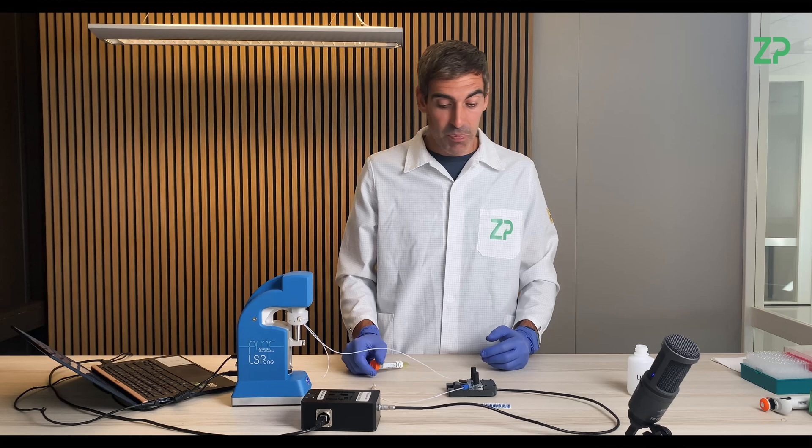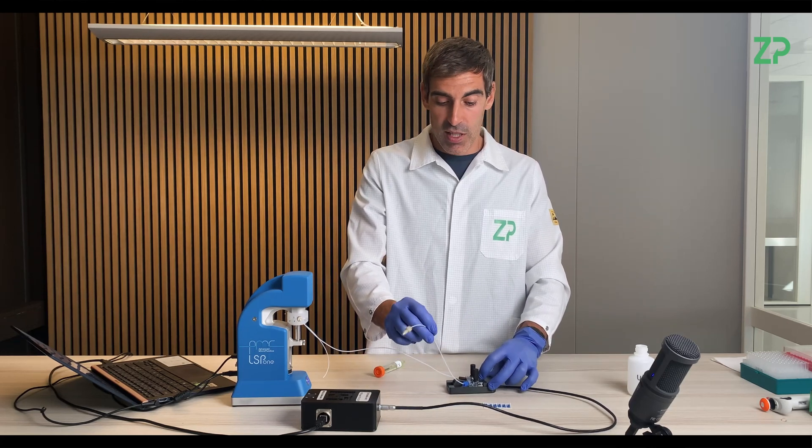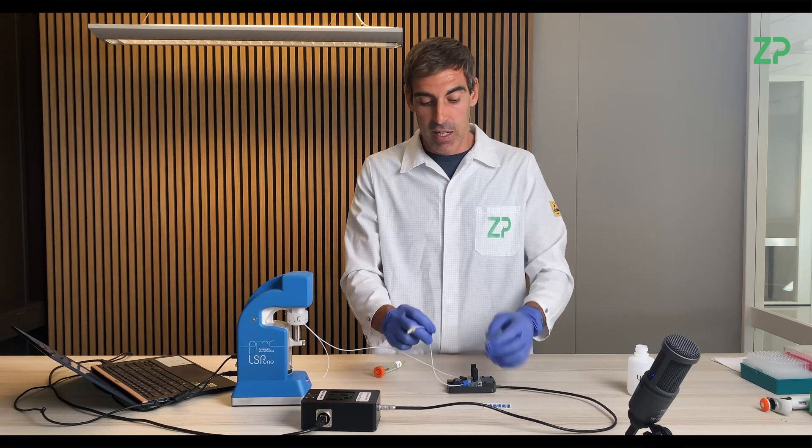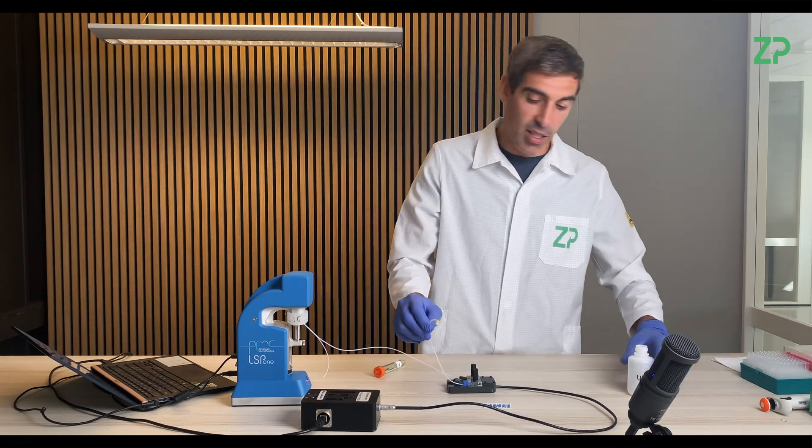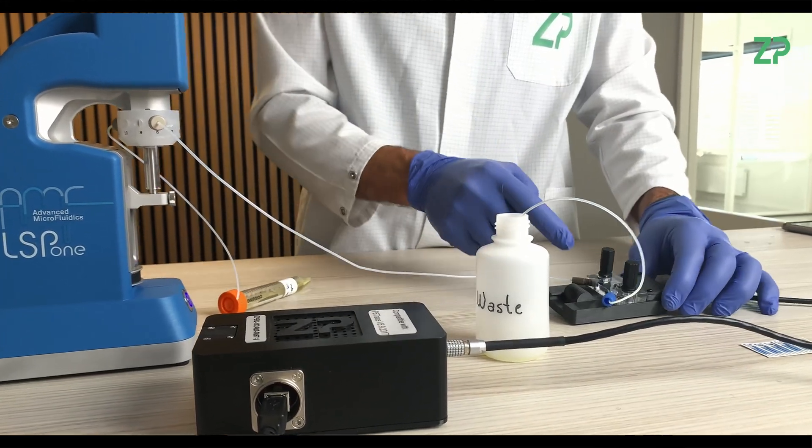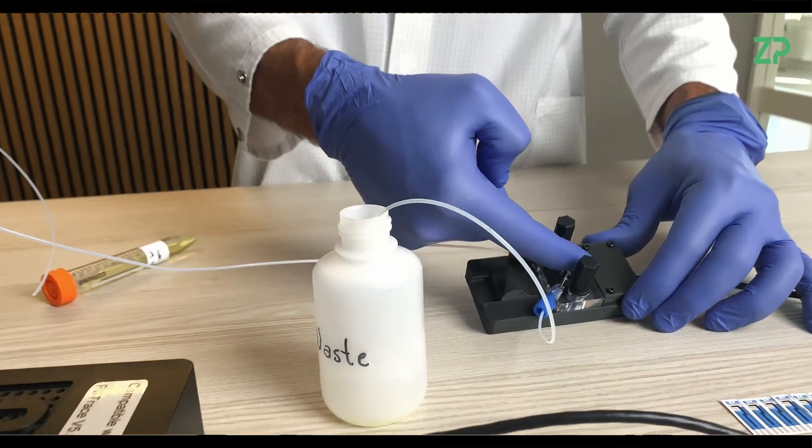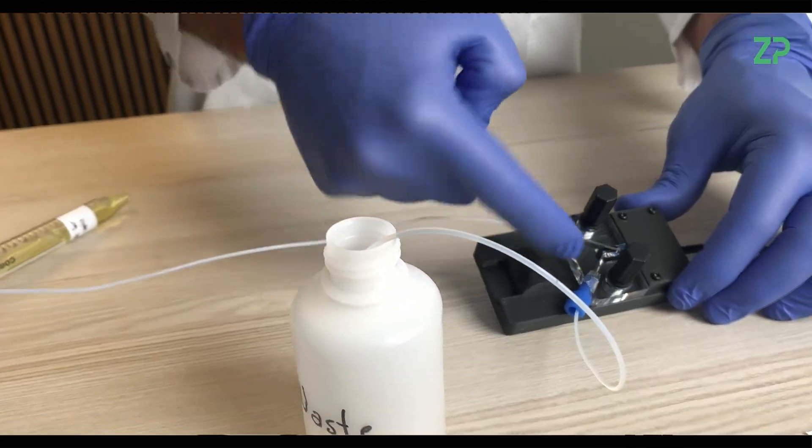Now, I'm not going to reuse this liquid, but you could actually reuse it. In this case, it's just going to a waste. So it will flow from this side into the sensor and then out this side into a waste container.